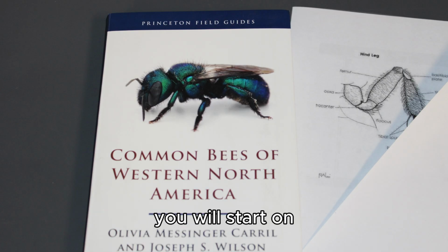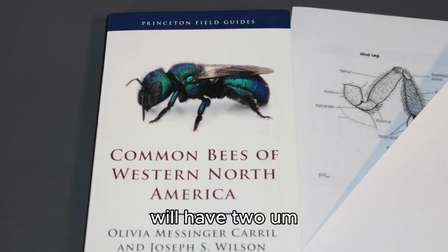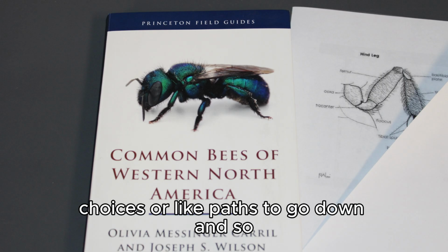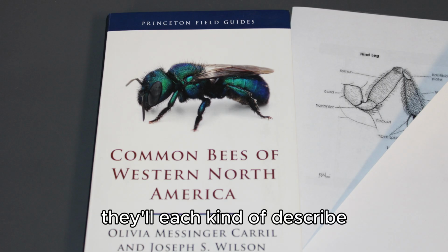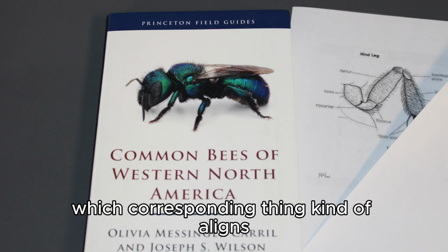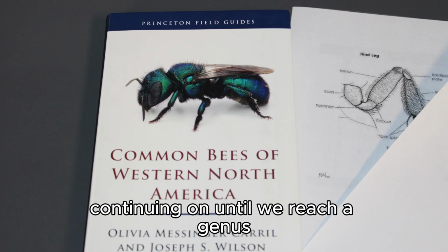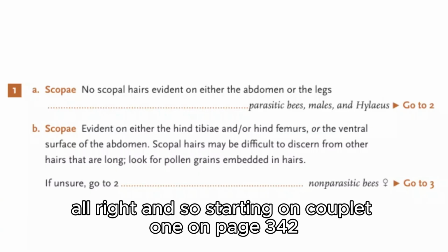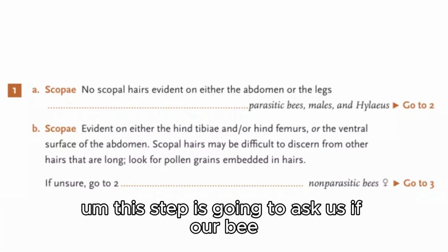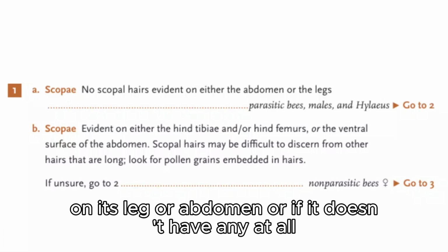You will start on couplet or step 1, and each couplet or step will have two choices, or paths to go down. They'll each describe characteristics, and then you will pick which corresponding one aligns with the bee that you have, and then you'll keep continuing on until we reach a genus. All right, starting on couplet 1 on page 342, this step is going to ask us if our bee has scopal hairs on its leg or abdomen, or if it doesn't have any at all.